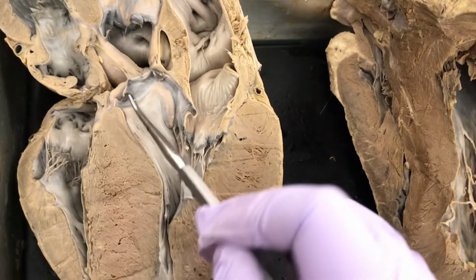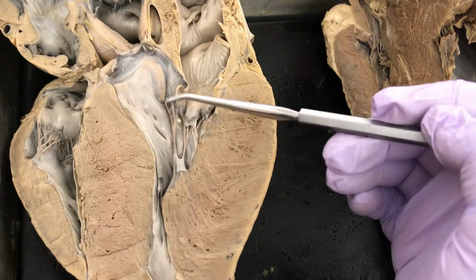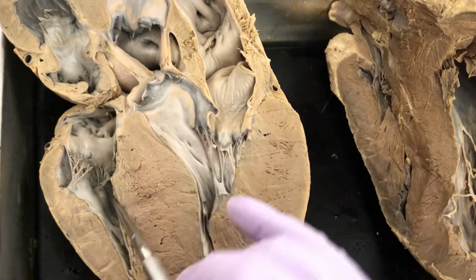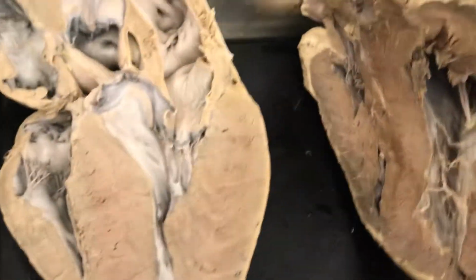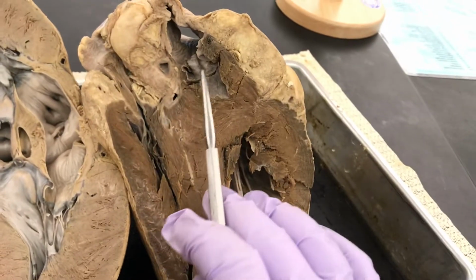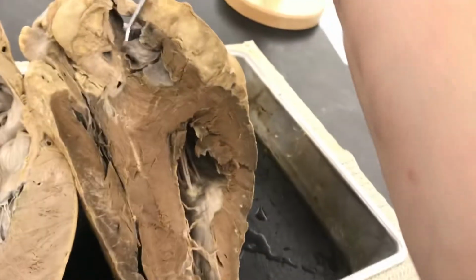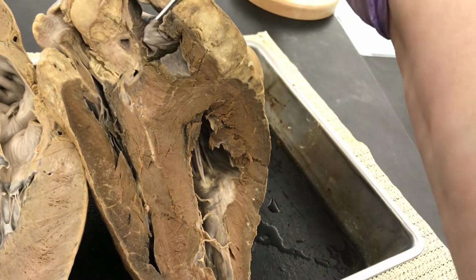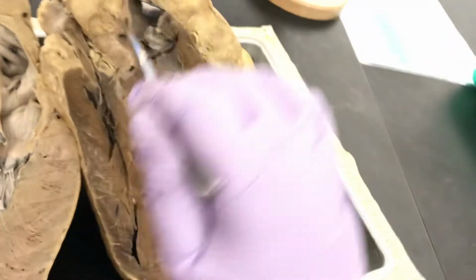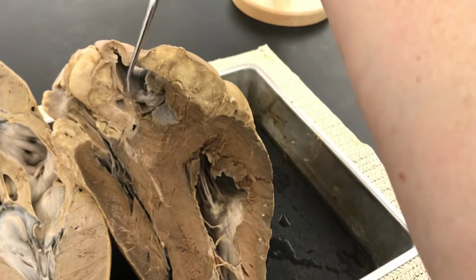Now we're going to look at the two valves going into the aorta and the pulmonary trunk. This is where it gets really important. You remember your blood flow through the heart. So we go from right atrium to right ventricle. From the right ventricle, we're going to go out through the pulmonary semilunar valve. Now this heart is cut so that we can see that pulmonary semilunar valve. And on the exam, if we ask this one, it will be on this heart that's cut all weird so that you can see this flap going into the pulmonary trunk on the front of the heart. So there's your pulmonary semilunar valve, that little flap.